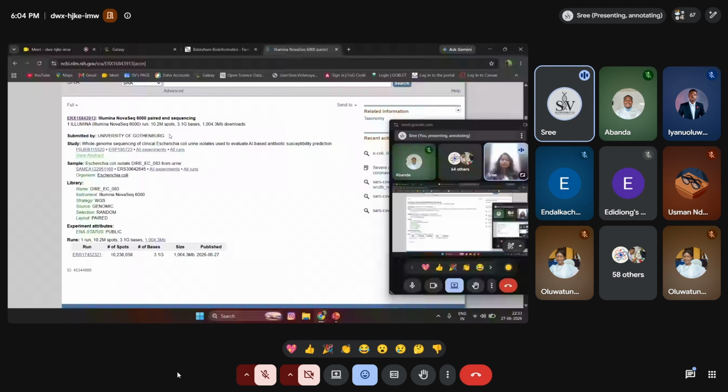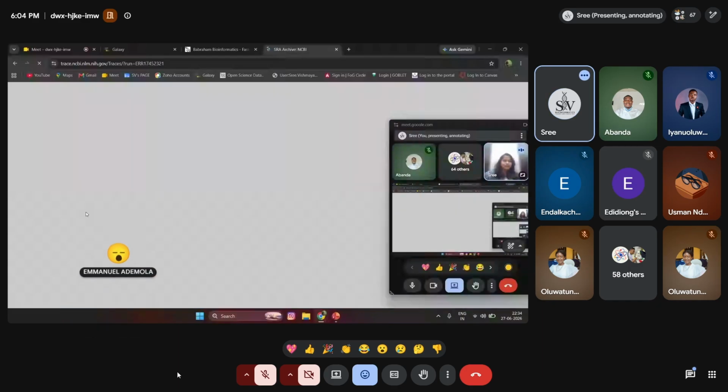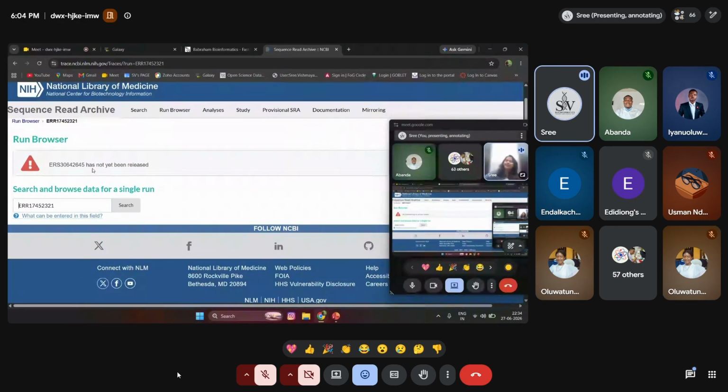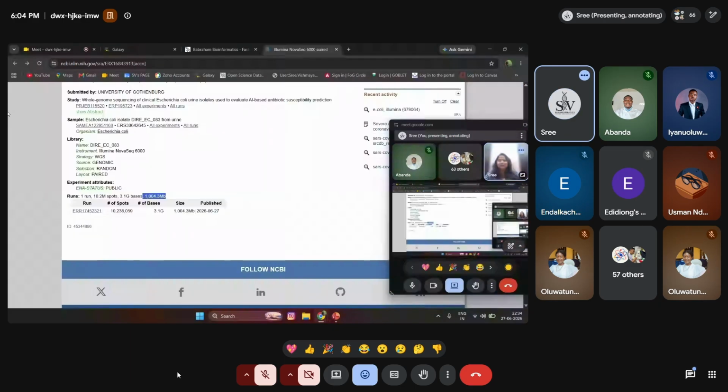If you select the run over here, I hope you have explored all this yesterday. I think the session will go more into it. The data is very new, it's not released yet. So we'll go with some other data with a little less size. Okay, this is WGS data of Illumina, of smaller size. Randomly picking one.